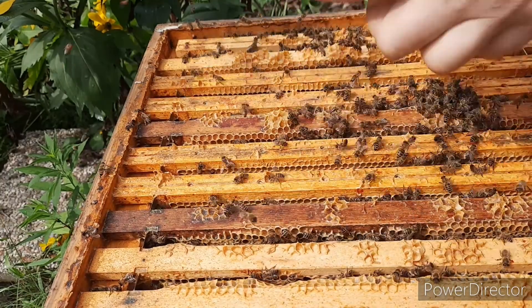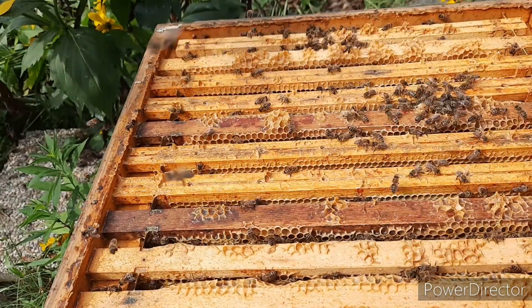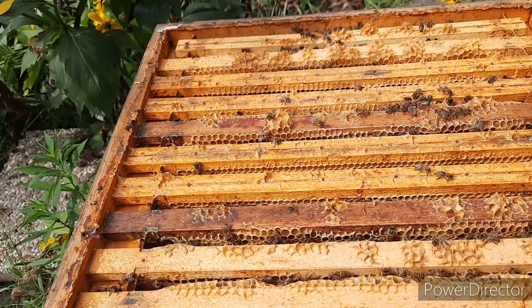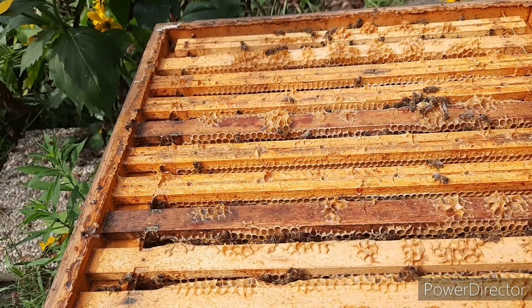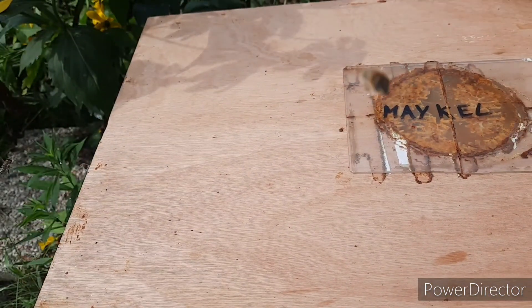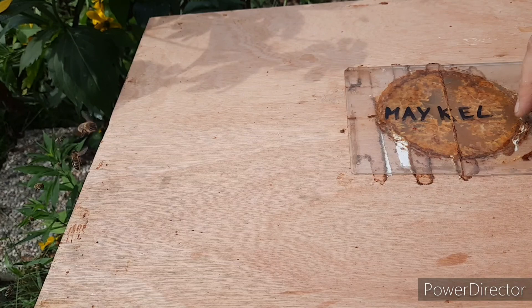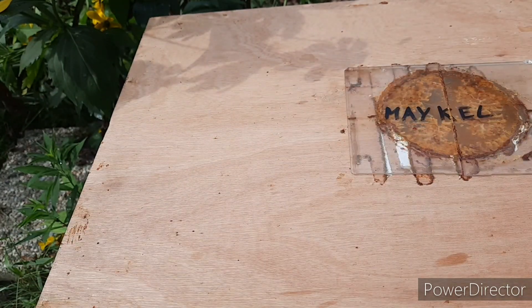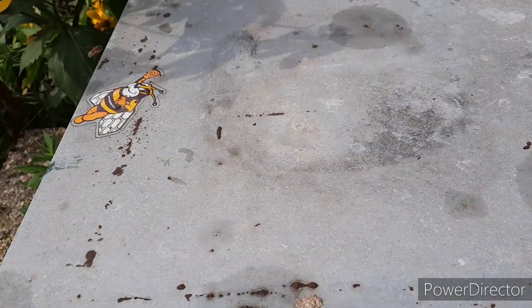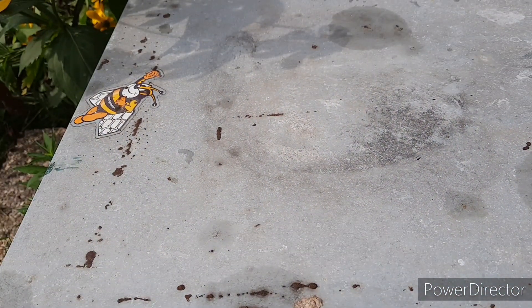Those remaining bees can go back — there they go. And that's part one of testing a honeybee colony. The rest happens at home — see you for the next part at home. Thank you.